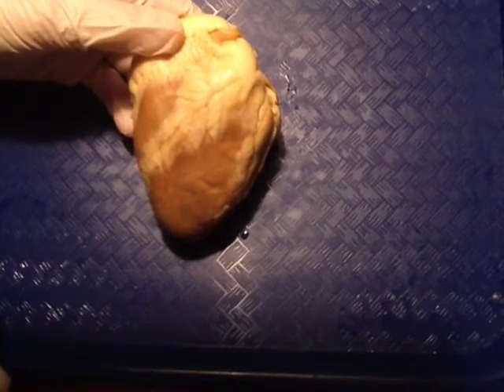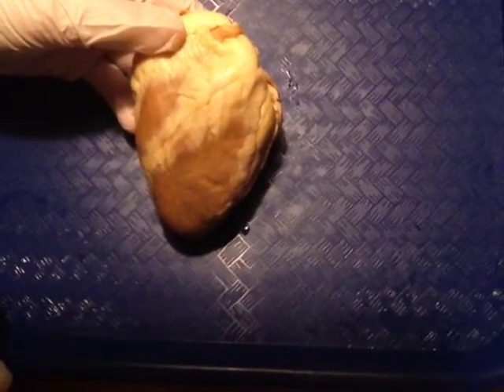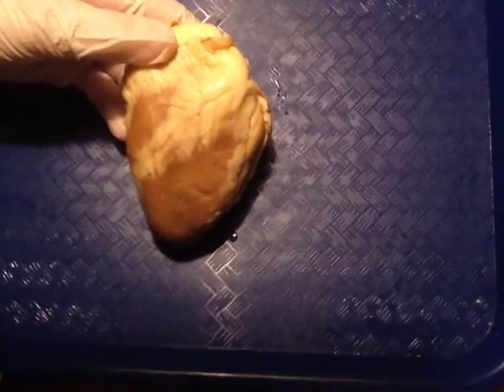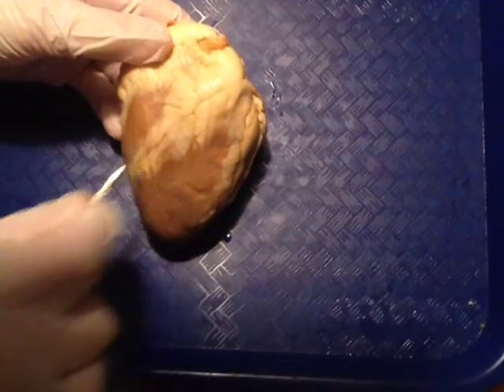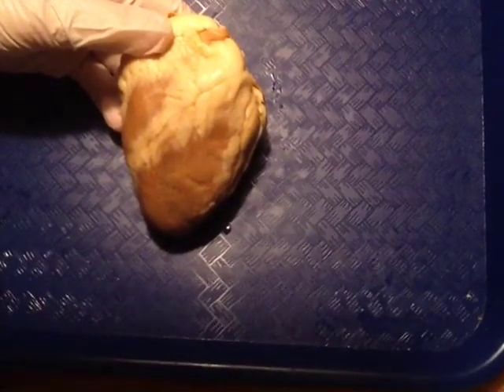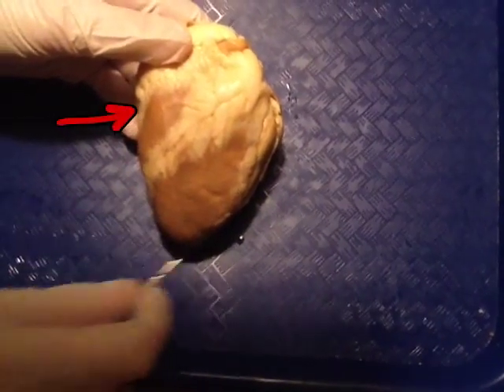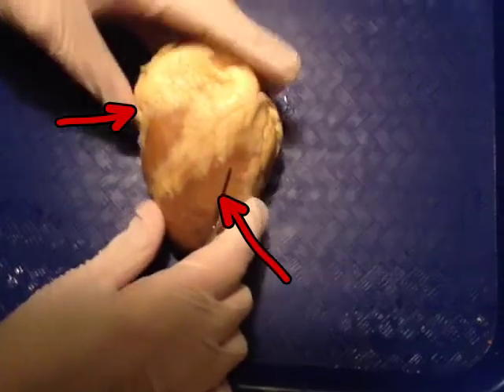Hello, we are going to do a sheep heart exploration. Right now we are looking at the anterior, or the outside of the heart. Notice this area here separates the two halves of the heart. We have the right ventricle and the left ventricle. Let's take a look inside.